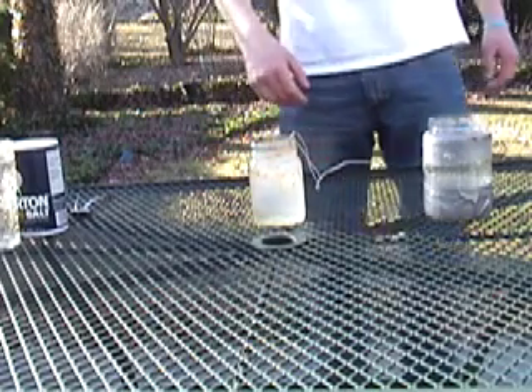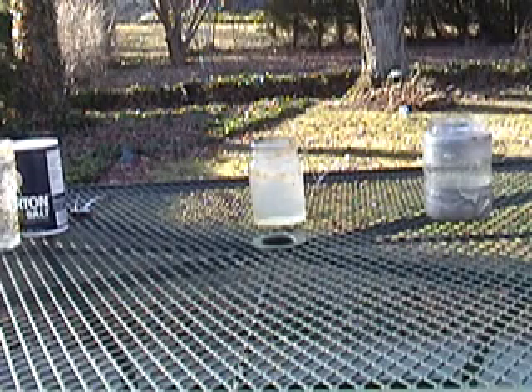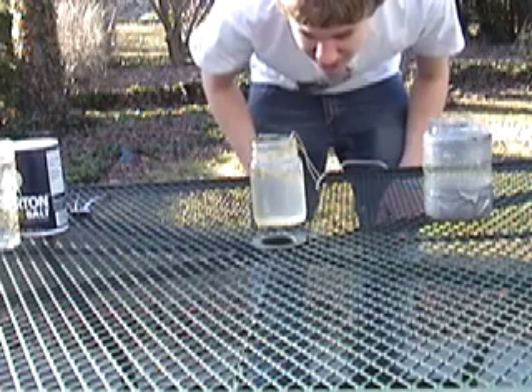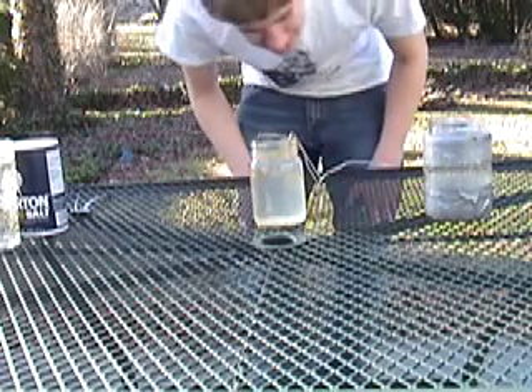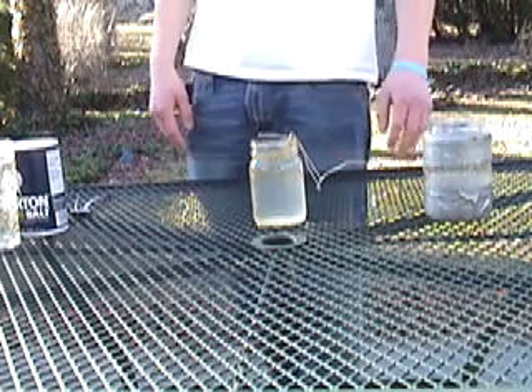Alright, I've got my little converter. I'm just going to plug this into my extension cord. You should start up a little slow and then you'll see it. You're just going to let that sit for a bit until the water turns a black color. In a couple of seconds you should start to see the water significantly change color.